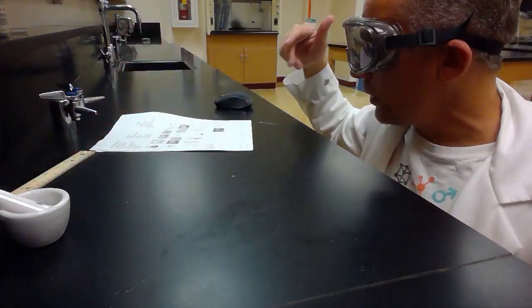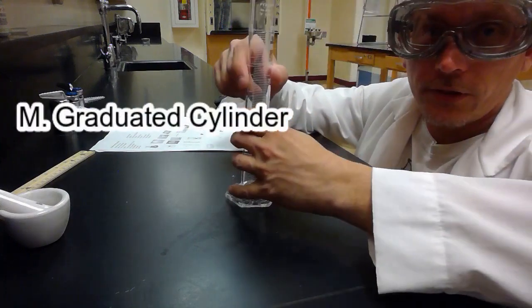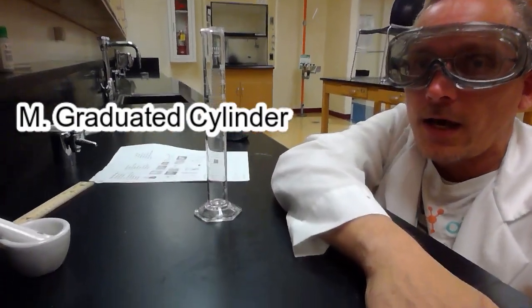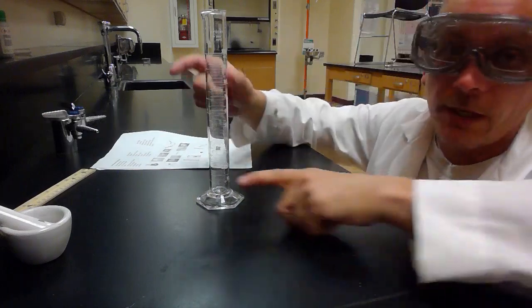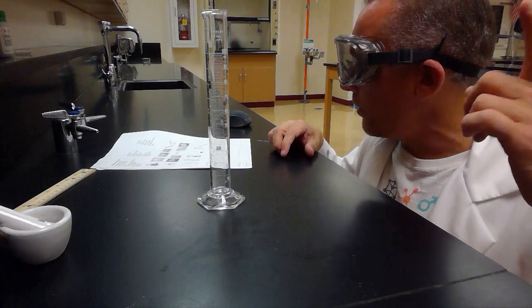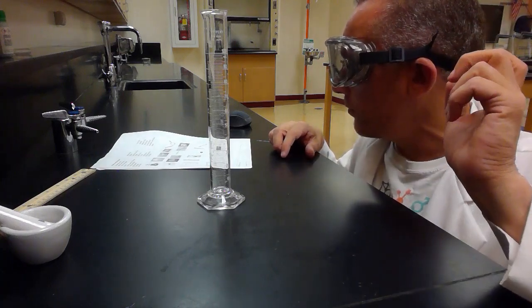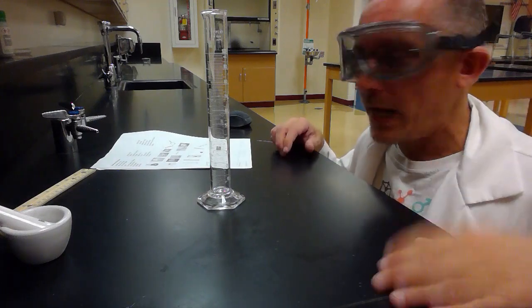And then picture M is a graduated cylinder. We saw the graduated cylinder in the video the other day. The graduated cylinder is used for measuring the volume of a liquid. So we put a liquid in there and we can measure its volume based on the scale there. So there we have the mortar and pestle, picture L. We have the ruler, picture J. And we have the graduated cylinder, picture M.